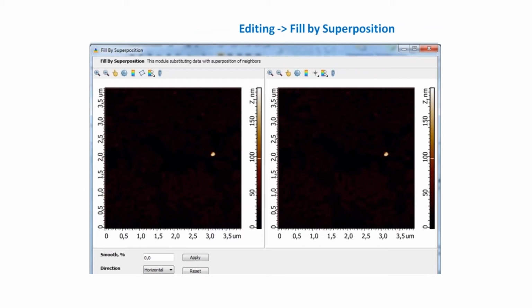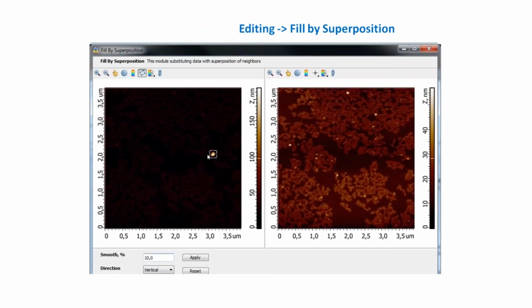One more way of removing some specific artifacts is called Fill by Superposition, where we have the artifact we want to remove, and when we choose it, the algorithm takes the surrounding data and just removes this annoying object. Some people say that this is not honest, that you should not use this method because this is not real. It's like Photoshop.